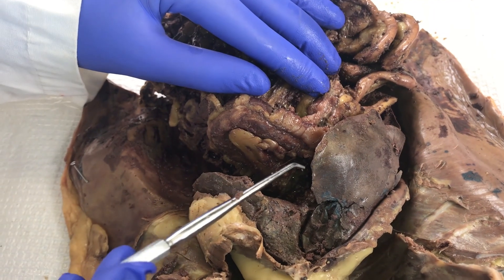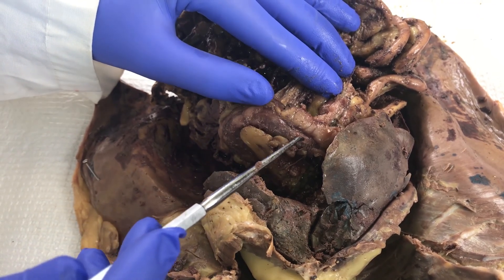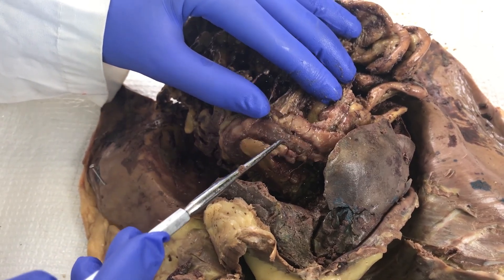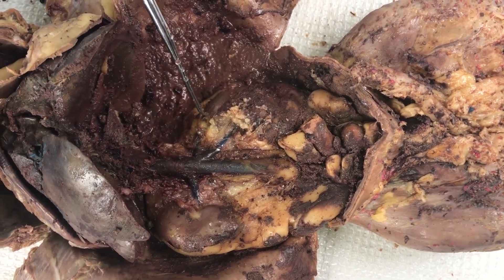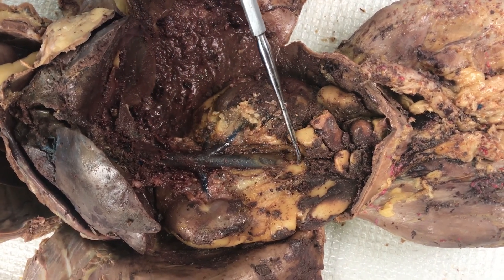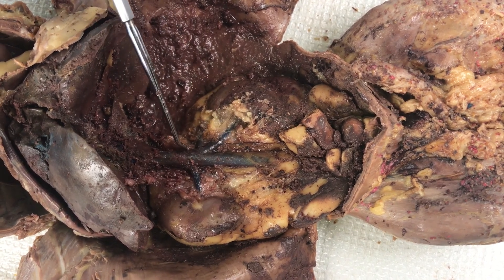In this specimen, we have the liver and right now we're looking at the stomach. You have to move tissue to be able to see that stomach clearly. Looking at some vasculature, we have those kidneys embedded in the body wall, and a very nice caudal vena cava with renal veins going off to support the kidneys.